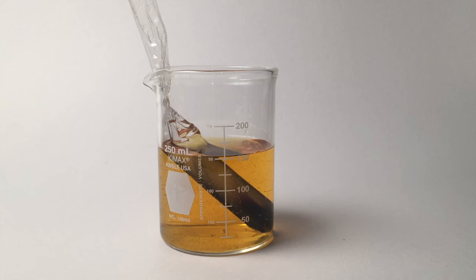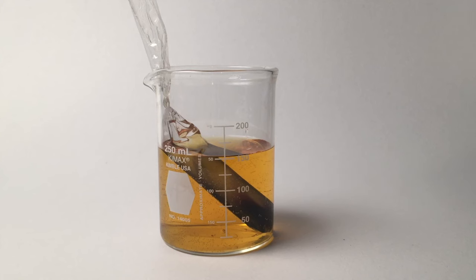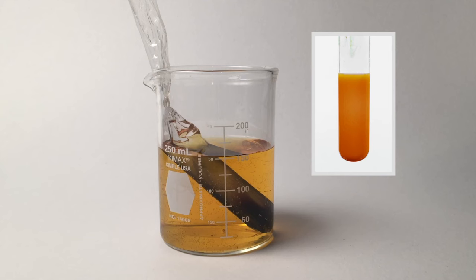Just iodine went into the bag. The final test we'll do is for sugar or glucose. And if we test that yellow water by putting it into a Benedict's test, we get a positive test. So that means glucose made it out of the bag.